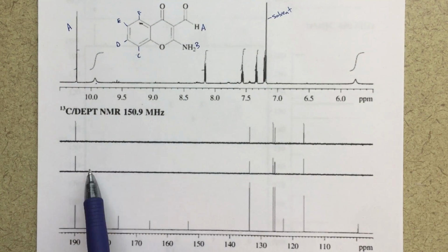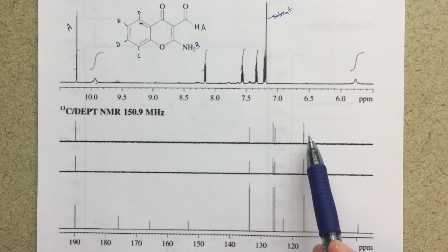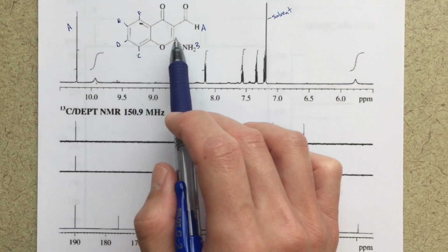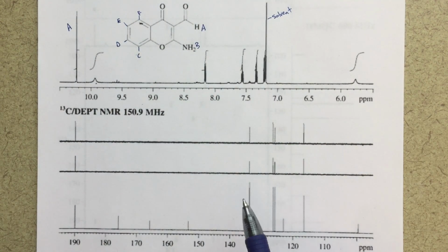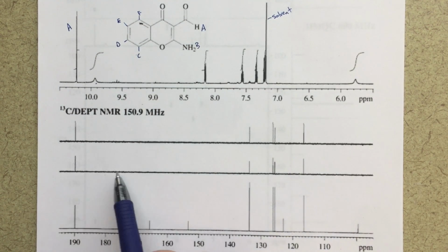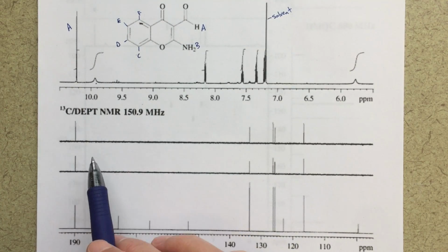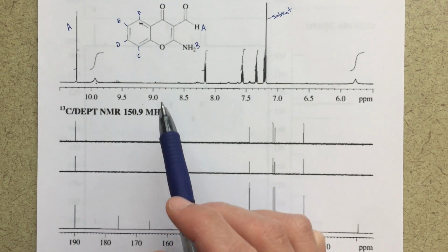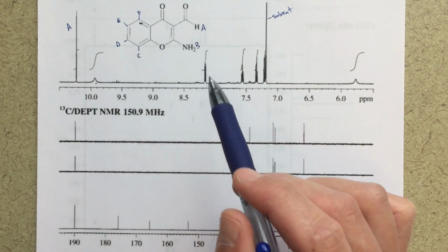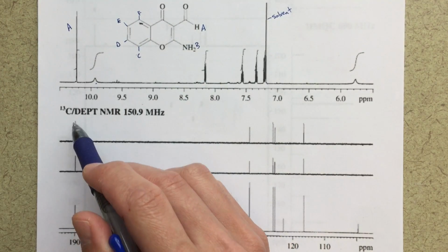So these 2 experiments here are showing us which carbon, so this is my carbon spectrum, right? I've got 1, 2, 3, 4, 5, 6, 7, 8, 9, 10 different carbon signals for my 10 different carbons in my structure. These signals, the ones at like 117, 125, 126, all of these signals, since it's the DEPT experiment, are telling me that these are the carbons that have actual protons bonded to them. This carbon here that has the aldehyde proton, I already know that's going to be this one here.